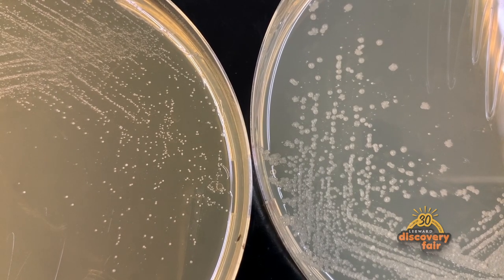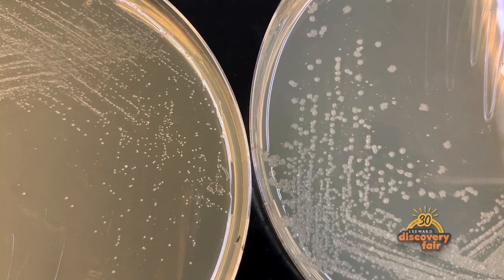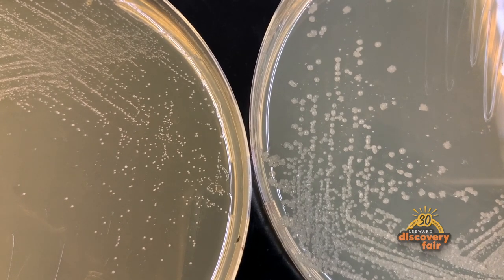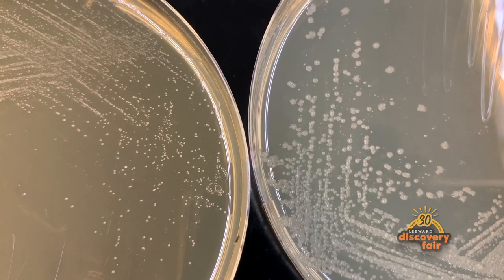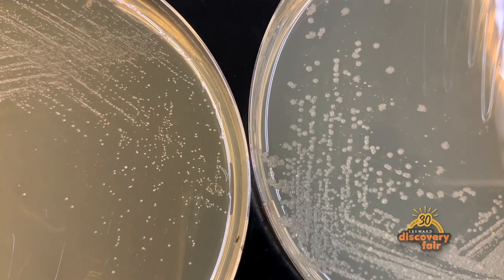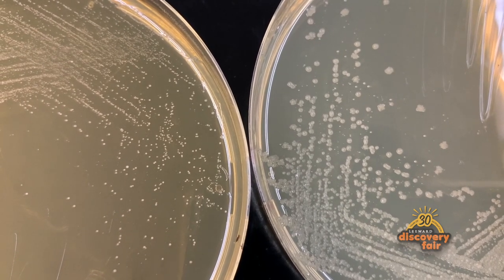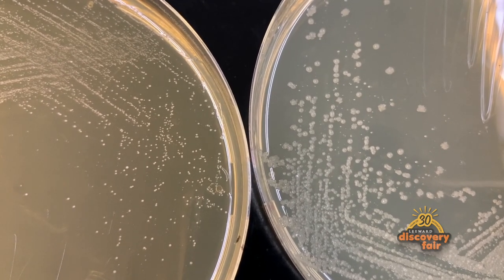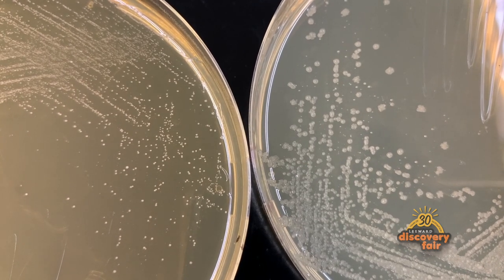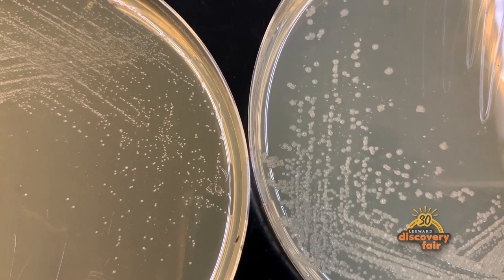The reason that the bacteria growing on sucrose look bigger is because when you feed them sucrose, they can form this protective layer that allows them to stick to your teeth. What you are looking at here is literally plaque on a plate. And this plaque keeps the bacteria around and over time can lead to tooth damage.